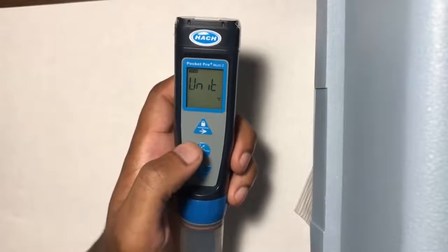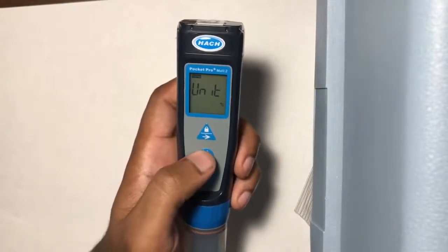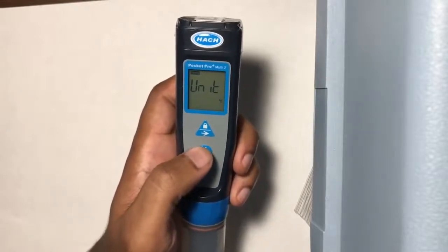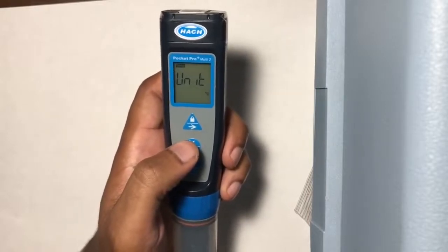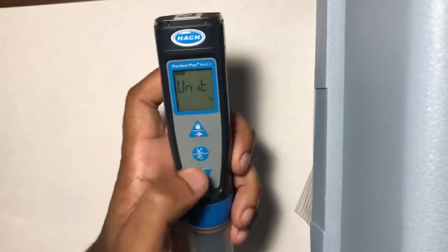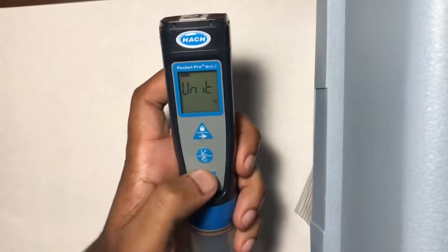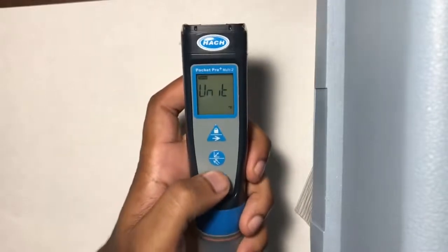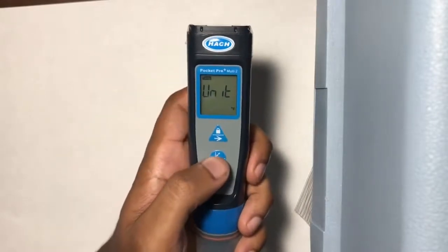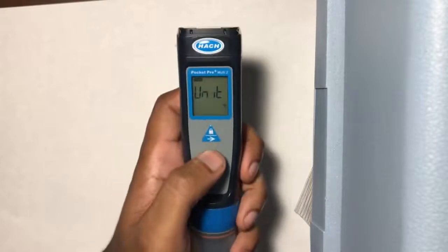Unit is the first parameter that appears after reaching SET. This setting changes the unit of measure for the water temperature. For scientific analysis, degrees Celsius is considered the global standard. As such, we want our degrees in Celsius. You can use the top and bottom buttons to change between units. Here I've set it to Fahrenheit, and back into Celsius again.